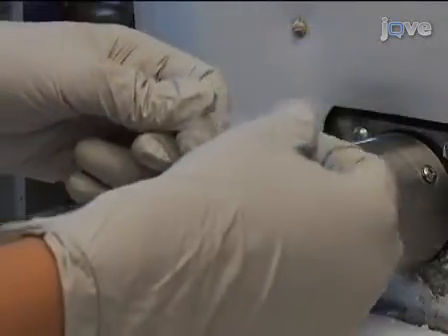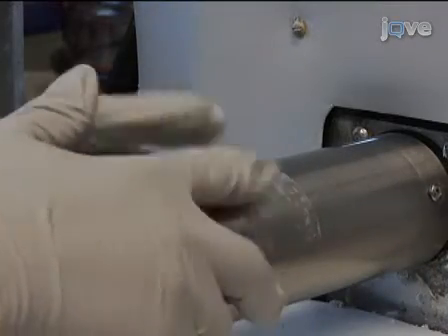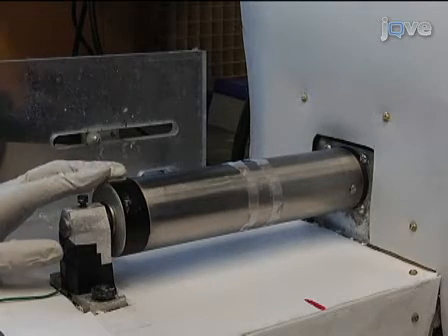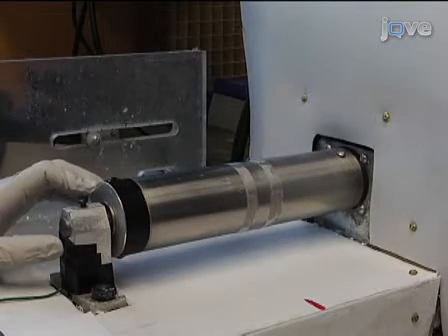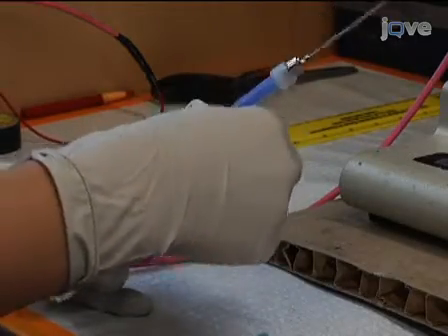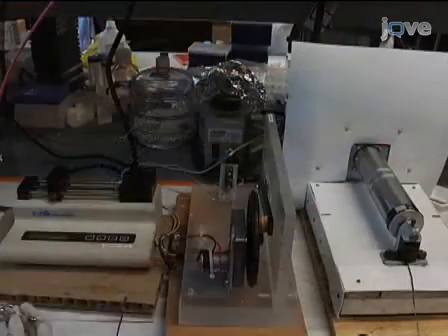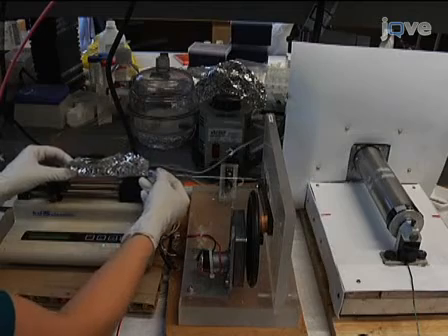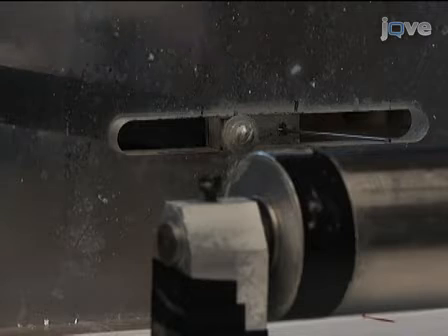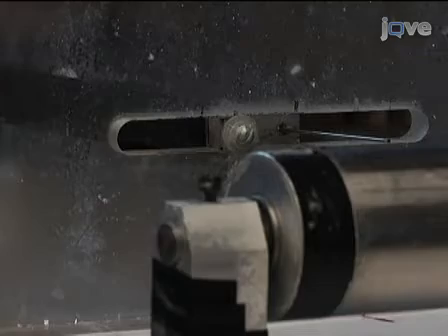Carefully use scotch tape to secure the edges of 22 mm by 22 mm methacrylated glass coverslips to the surface of the mandrel, such that the coverslips fit around the mandrel circumference. Using a 5 mm long piece of silicone tubing, attach one end to one of the syringes with luer lock attachments, and attach the other end to a needle. Insert the syringe into the syringe pump and put the needle through the hole in the fanner. The fanners translate the length of the mandrel and are used to ensure an equal distribution of both polymers in the resulting scaffold.